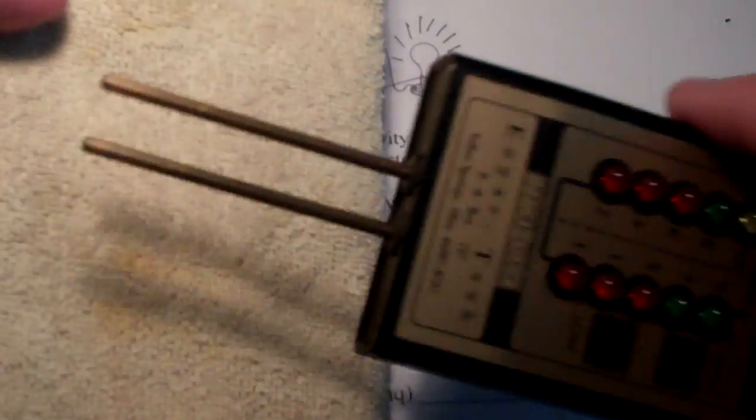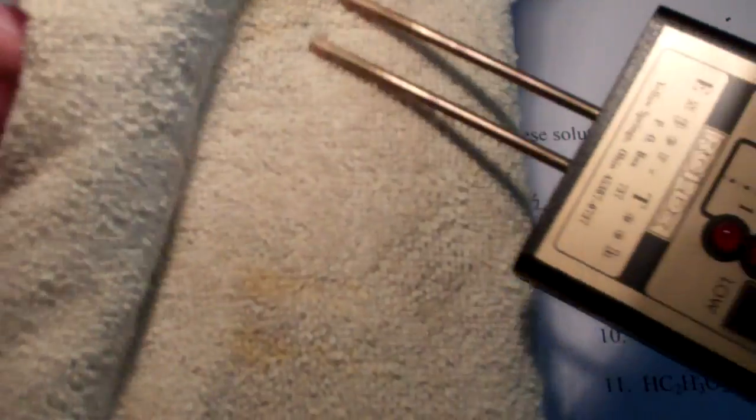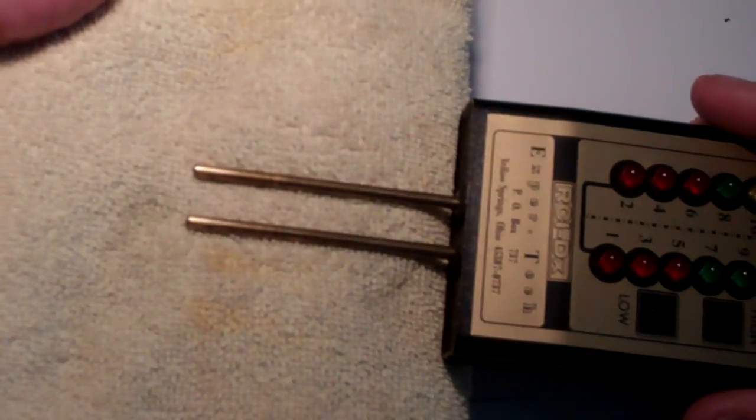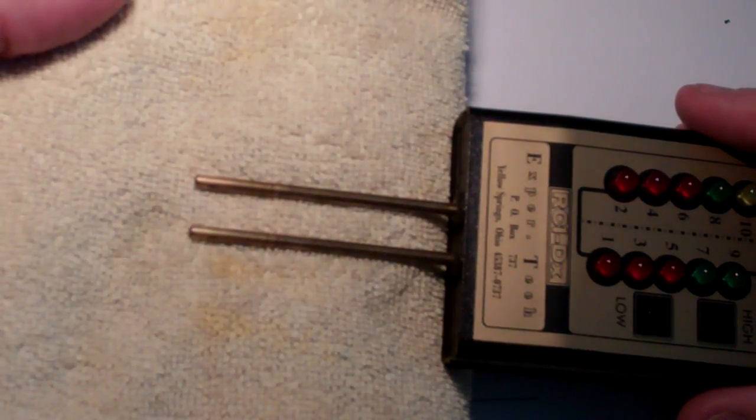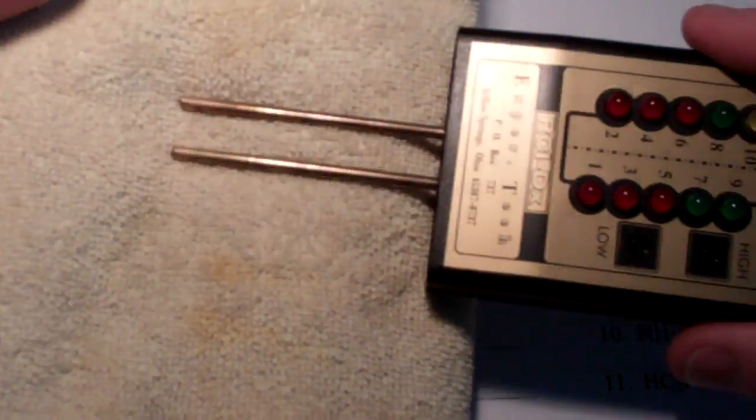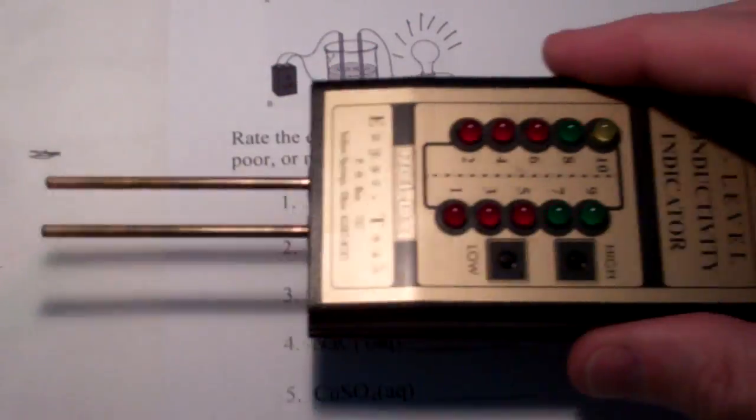Now, between tests, I'm going to make sure that I clean these electrodes off thoroughly, so we don't contaminate what was in the previous solution with the current solution. So, these will be cleaned quite thoroughly between tests.